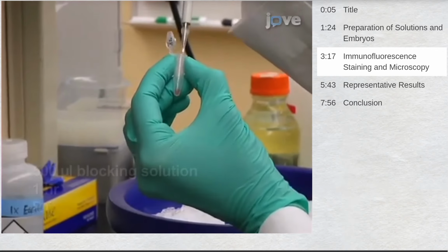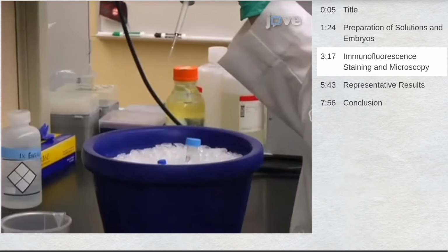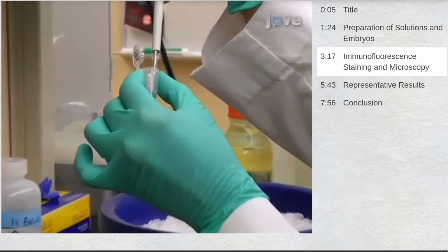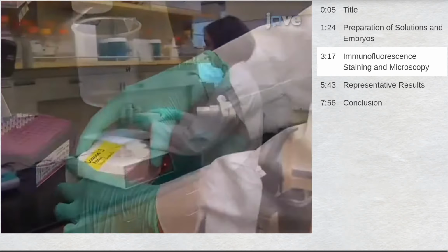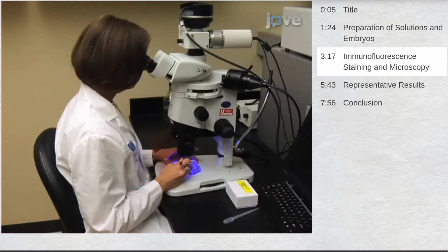Remove the PDT wash and repeat the blocking step. Then, add the appropriate fluorophore-conjugated secondary antibodies. Shield from light and gently rock for 1 hour at room temperature. Under a fluorescent microscope with the appropriate filter, analyze the embryos in 1x PDT.